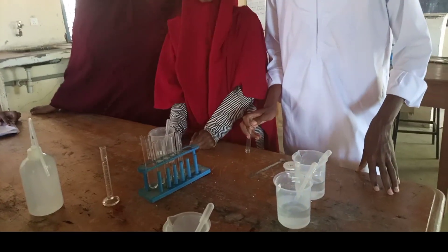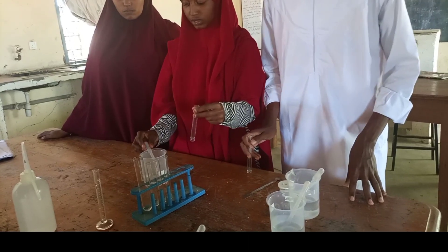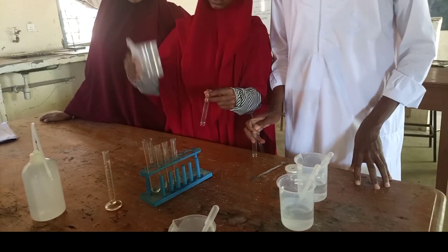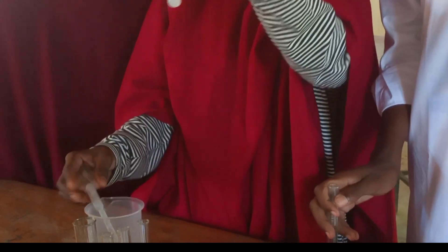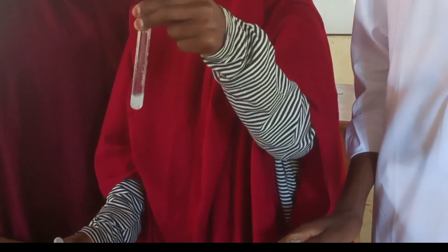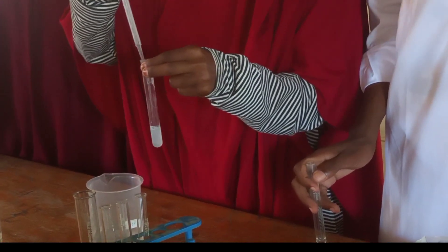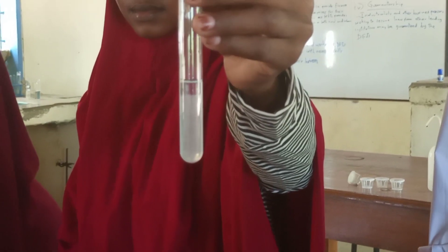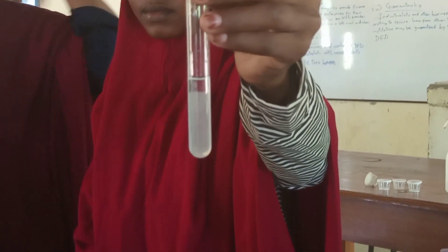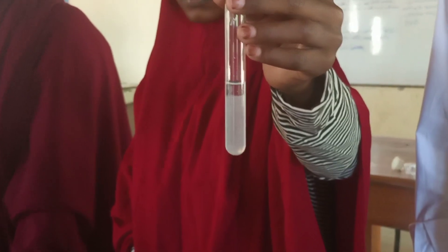For the second procedure, take the first portion and add three drops of sodium hydroxide, then add it in excess. The observation obtained is a white precipitate is formed which is insoluble in excess. The inference is that the cations present are either calcium ions or magnesium ions.